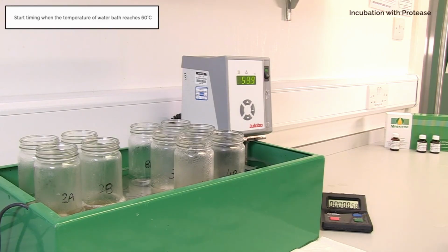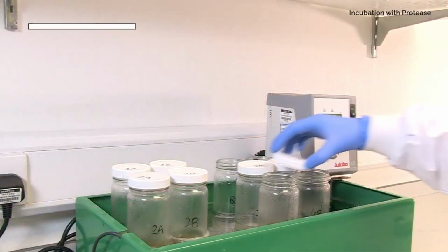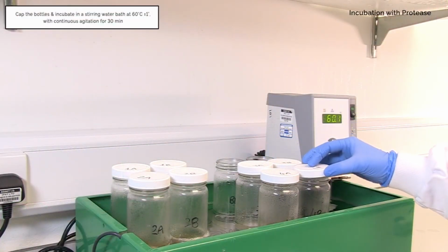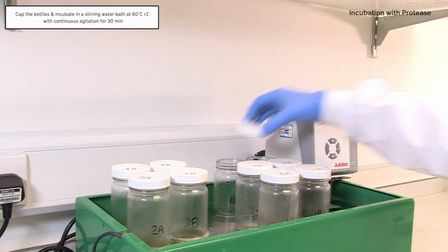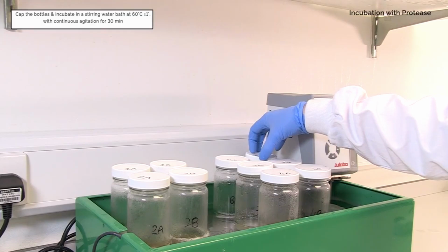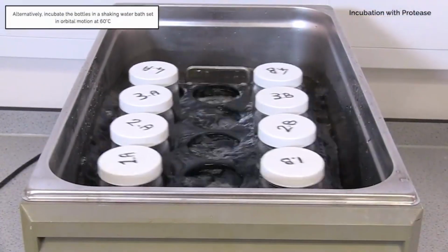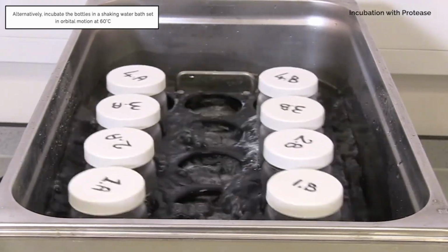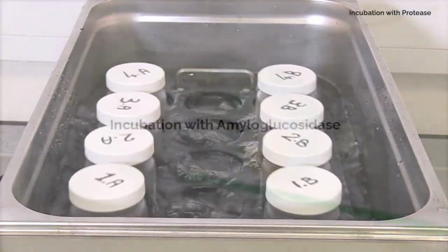Start the timer when the temperature of the water bath reaches 60 degrees Celsius. Cap the bottles and incubate in a stirring water bath at 60 degrees Celsius plus or minus 1 degree, with continuous agitation for 30 minutes. Alternatively, incubate the bottles in a shaking water bath, set in orbital motion at 60 degrees Celsius.